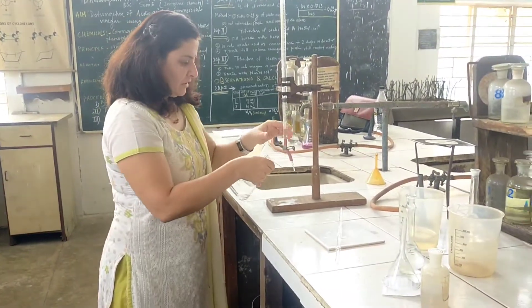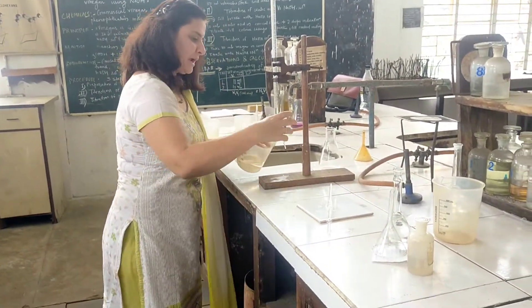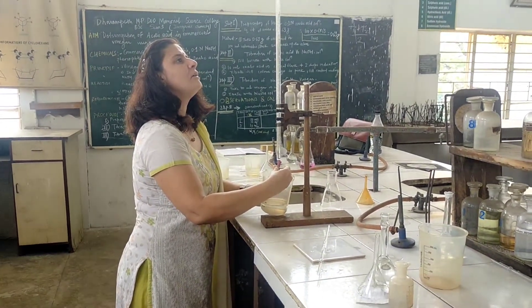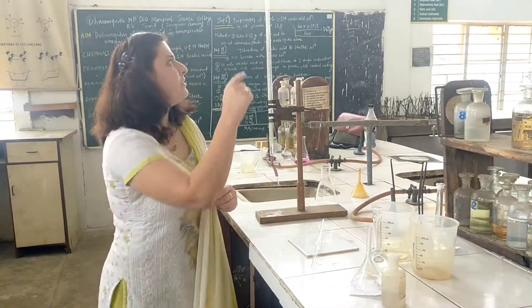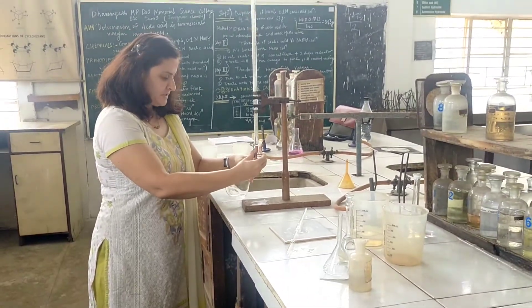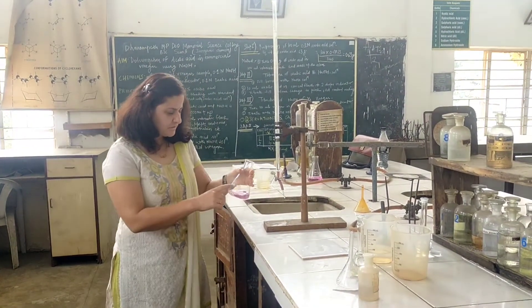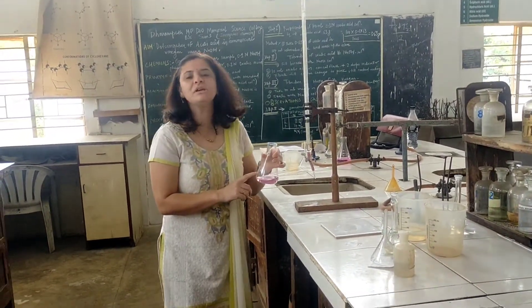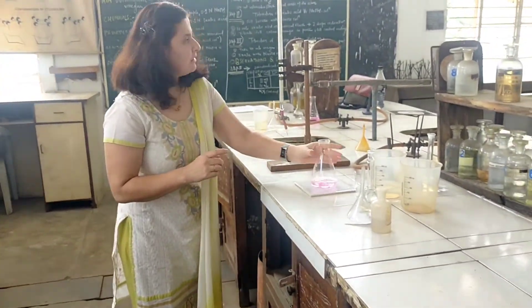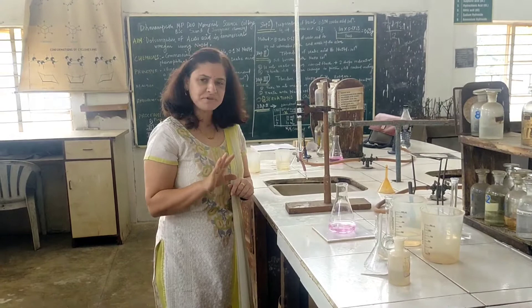Now we have to titrate. Some air bubbles should be removed prior to starting — this is a precaution we have to take. For colorless solutions, we generally consider the lower meniscus. Now start the titration dropwise. We just got a color change from colorless to pink. Our burette reading is 10 ml. We repeat this experiment 3 times to get constant readings.